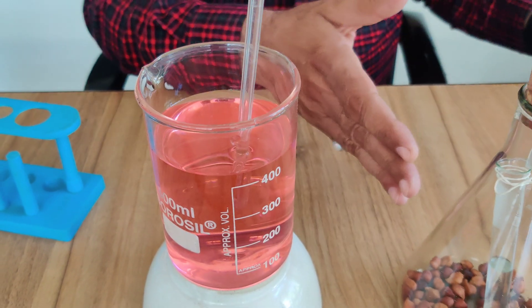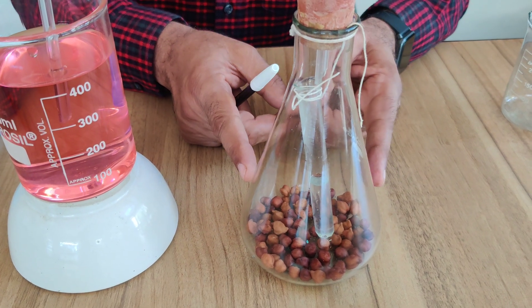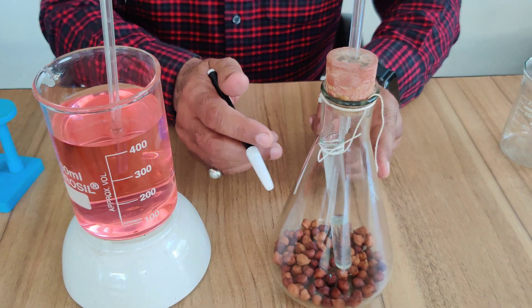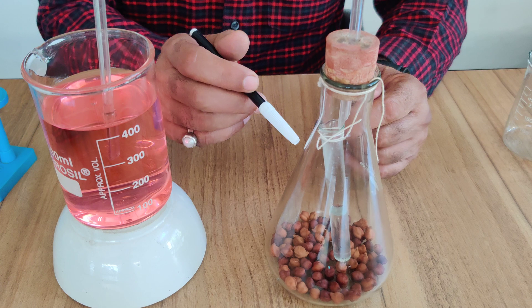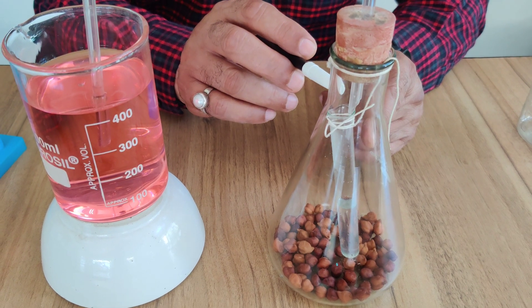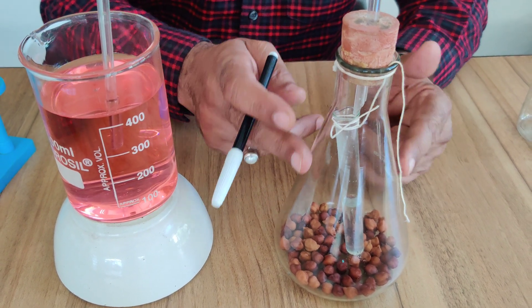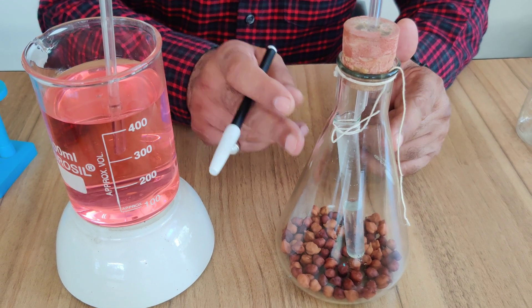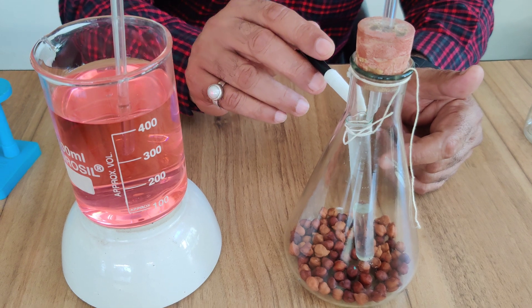Now, the process of respiration starts in these germinating seeds. The seeds take oxygen and give out carbon dioxide. Seeds take oxygen from the air inside the conical flask. The carbon dioxide released by the seeds will be absorbed by the KOH solution.